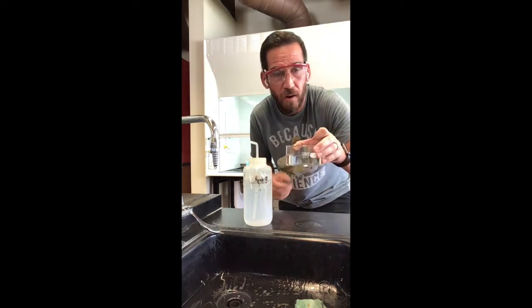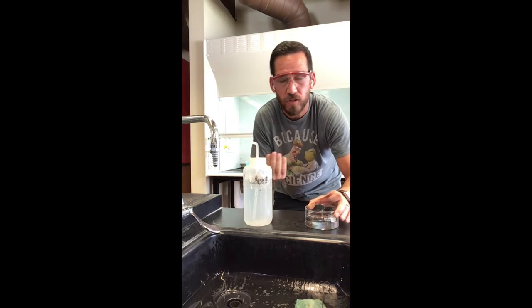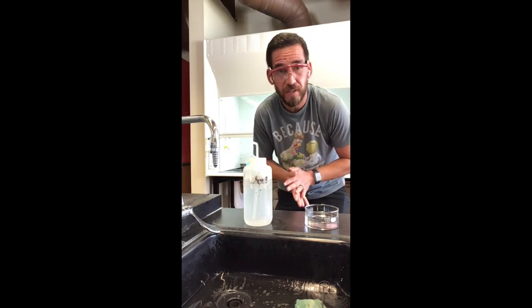If we just do it now, we've got it working while we're working, and then boom, boom, bang, you're in and out of lab. You've got better things to do, like study chemistry, write that lab report. More than likely, you've got other classes, a job, life, etc. So we want to work as efficiently as possible in the laboratory, and this is one way to do it. And the way we would have known this is by reading ahead.